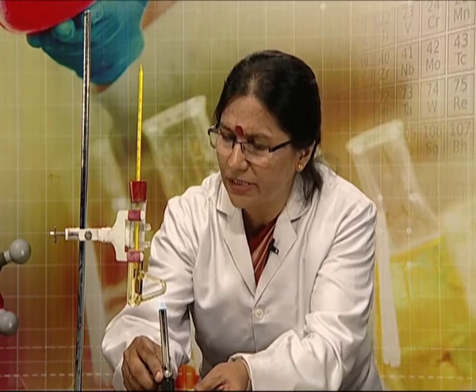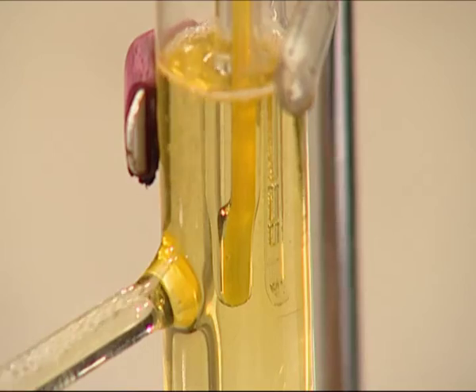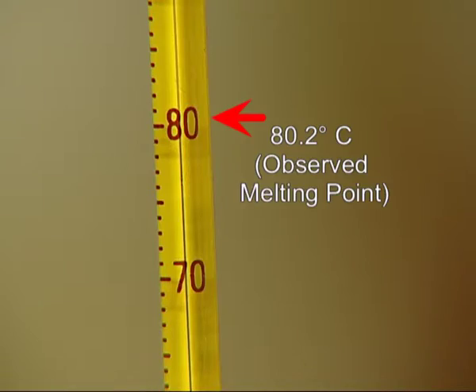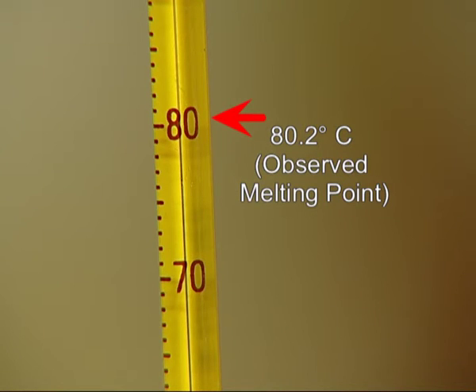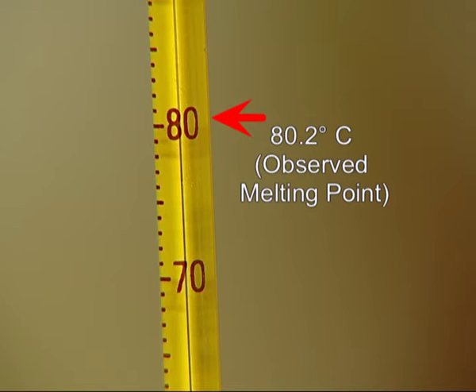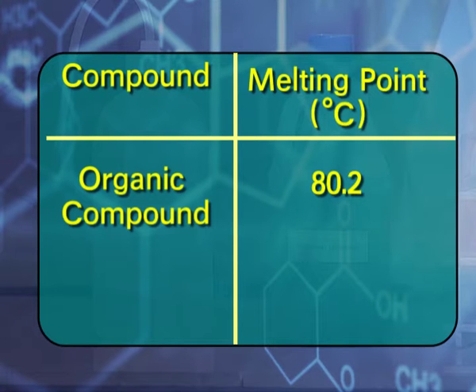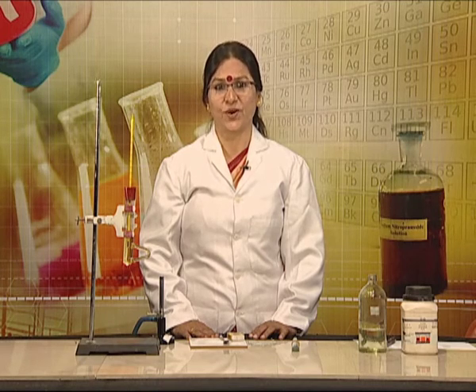Now the solid has completely melted. At this point we will switch off the burner and note the reading on the thermometer. Pure solids have a sharp melting point, which is an indicator of the purity of the substance.